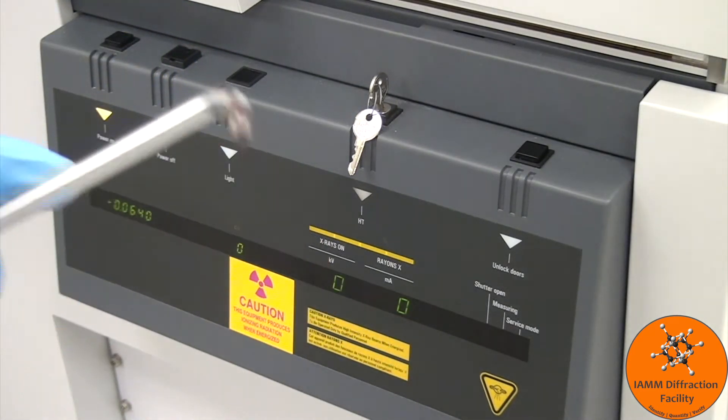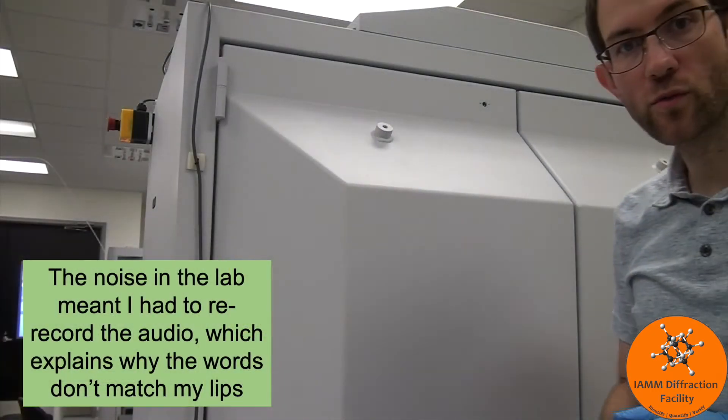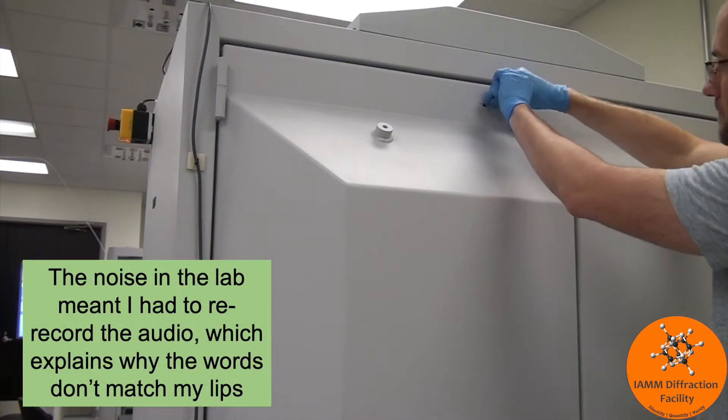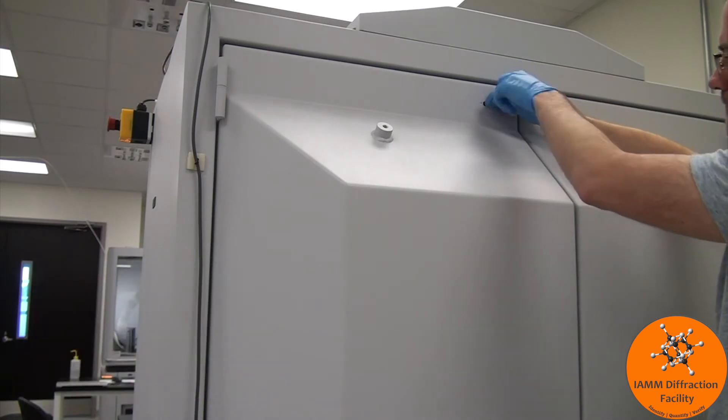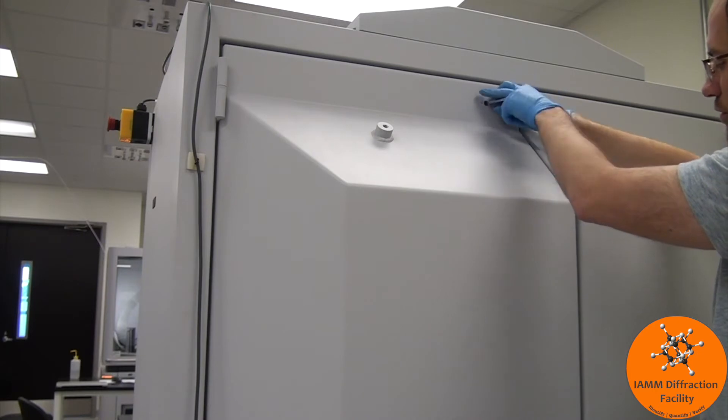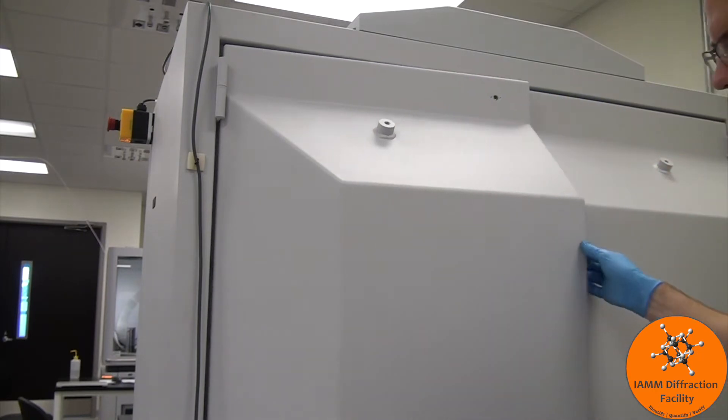We are then going to go to the back of the instrument and then what we want to do is loosen this right up here. Eventually the back door here will open up and you'll probably hear a slight click.